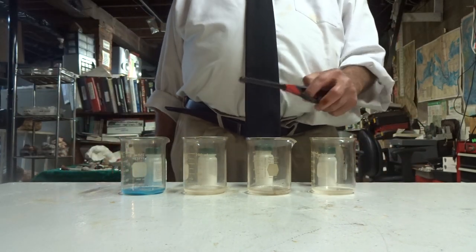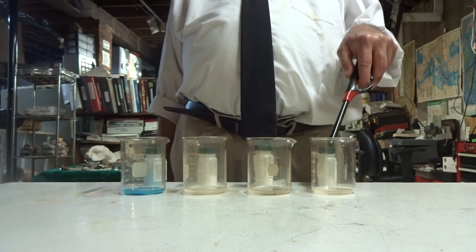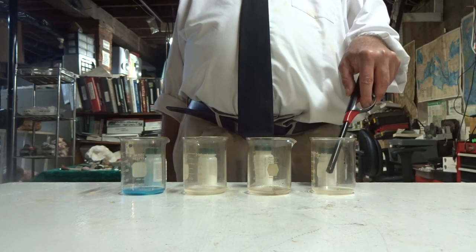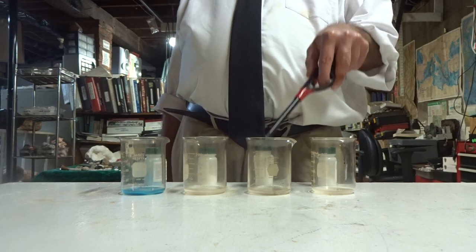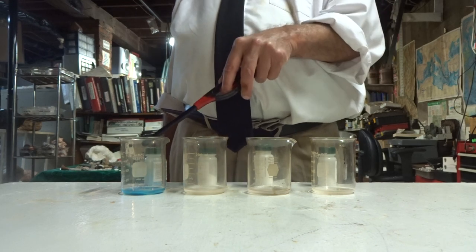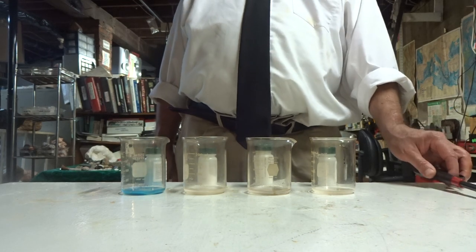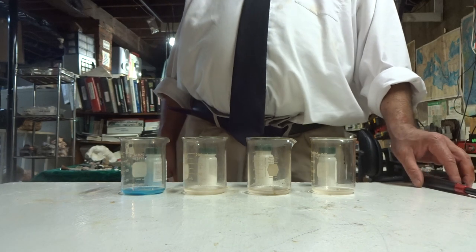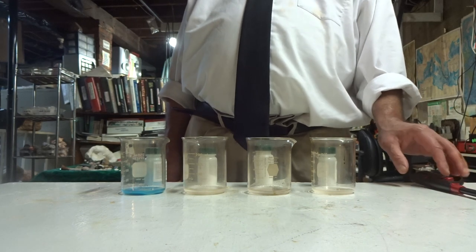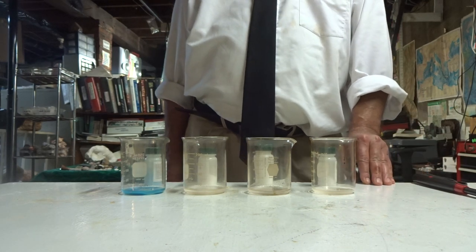Now what I'm going to do is, with a lighter, I'm going to light these four beakers. And we're going to notice that they all burn a different color. Now why is this happening? It's because of the cations.